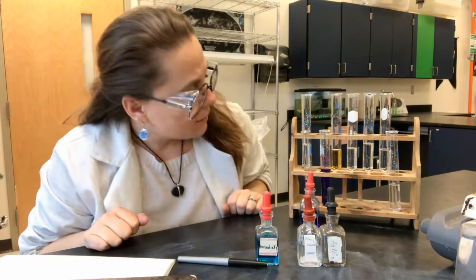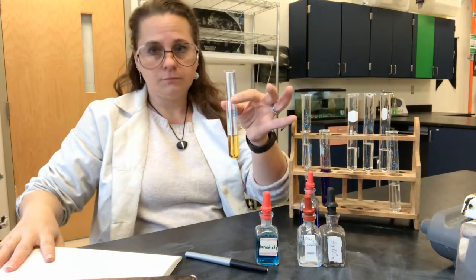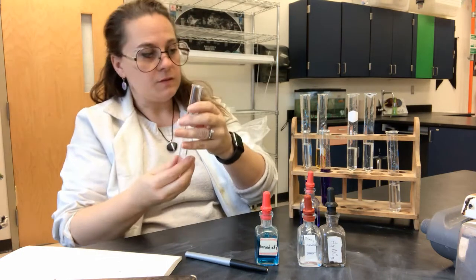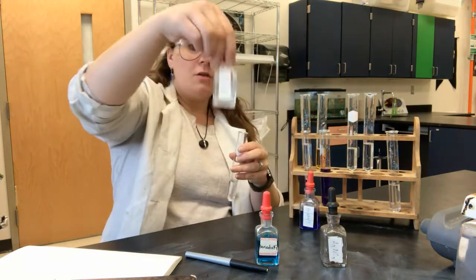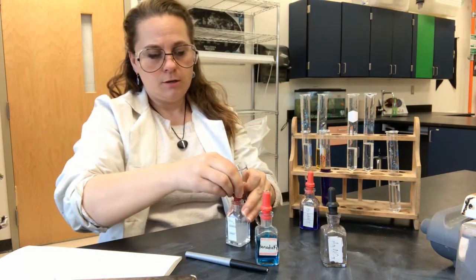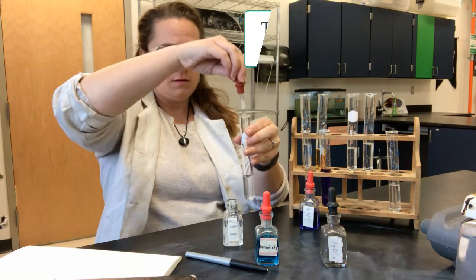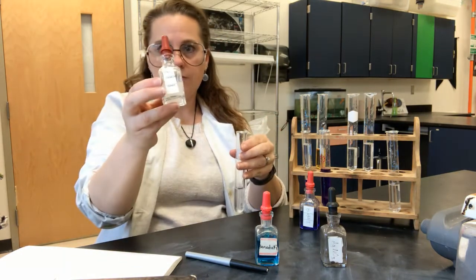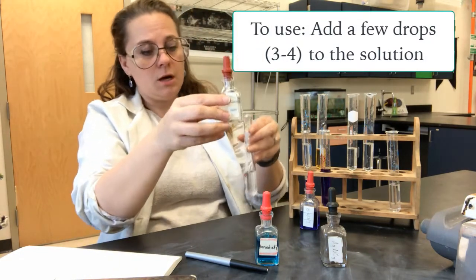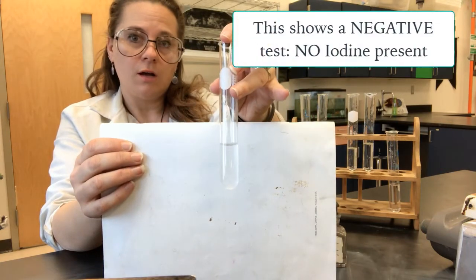The next one is an indicator for iodine. My iodine solution is right here. To stay consistent, I'll show you what happens in the presence of no iodine — I'm going to use starch to determine that. Taking my starch and adding it in, it begins as a very opaque, sometimes clear depending on concentration color. You can see that I still have a very clear color present.